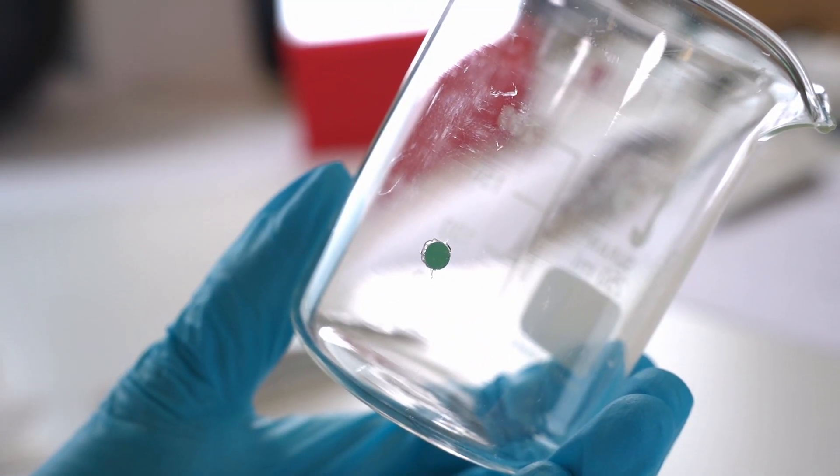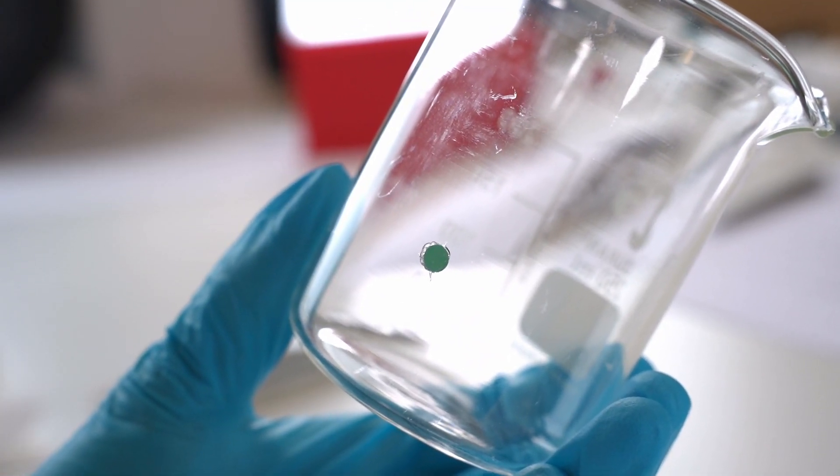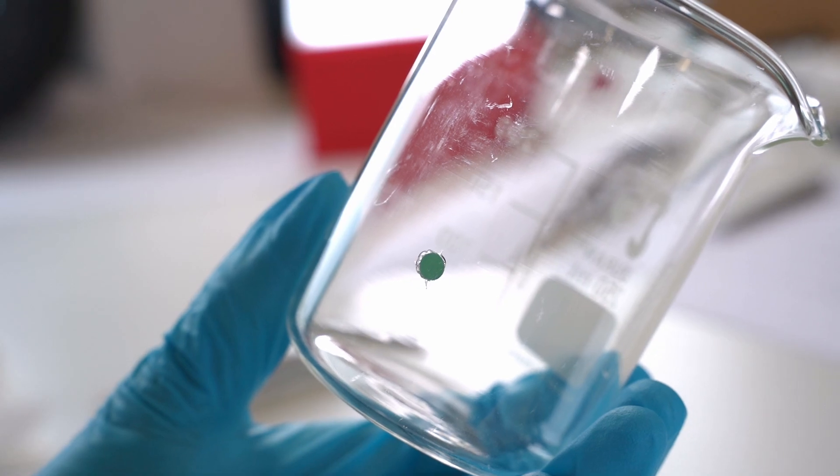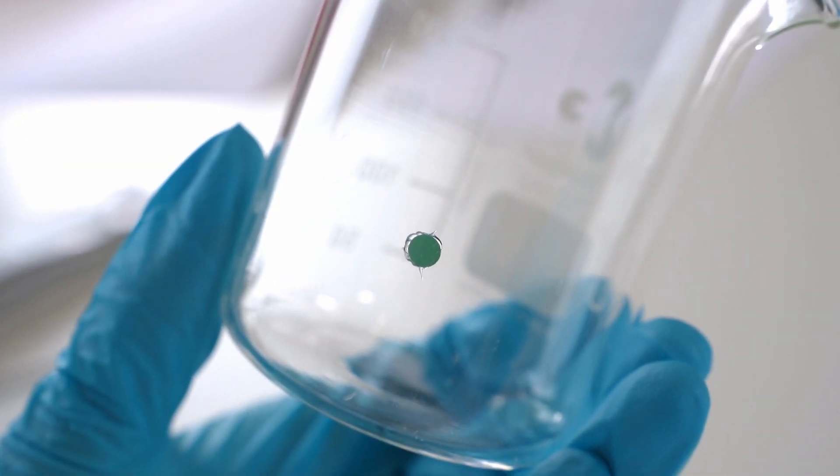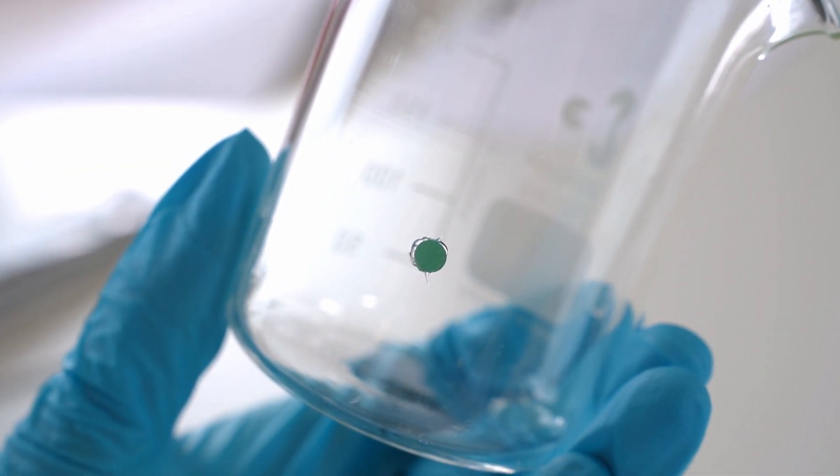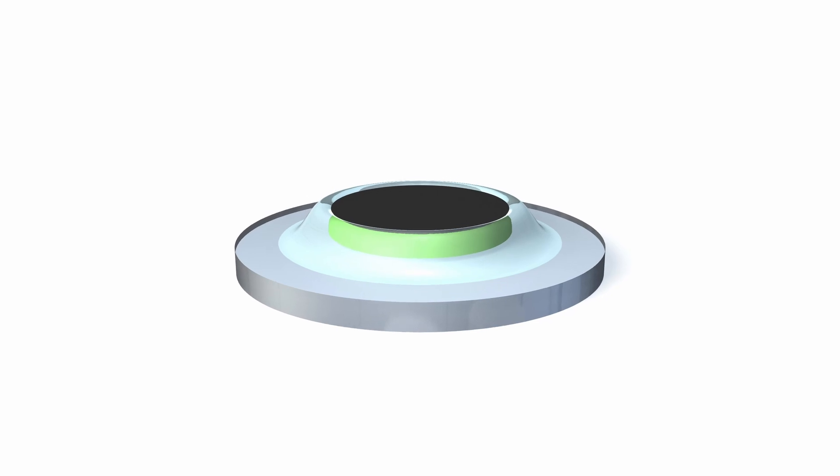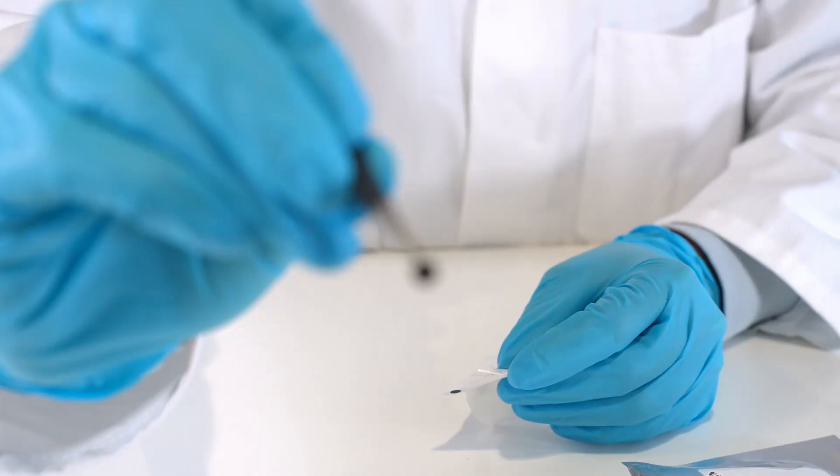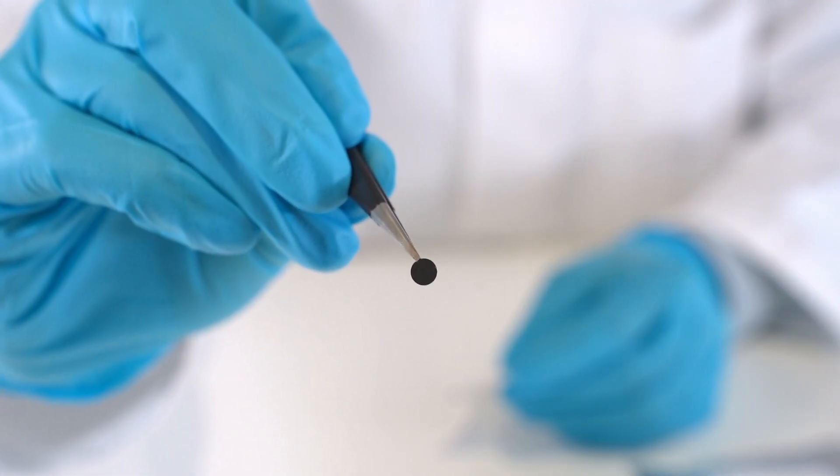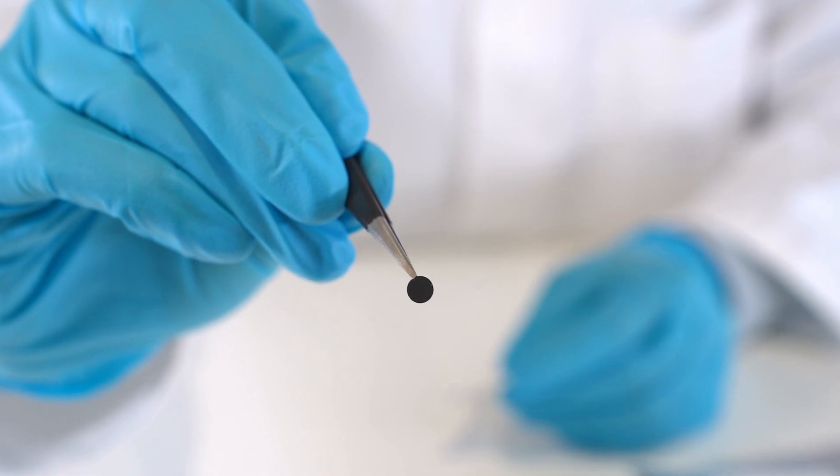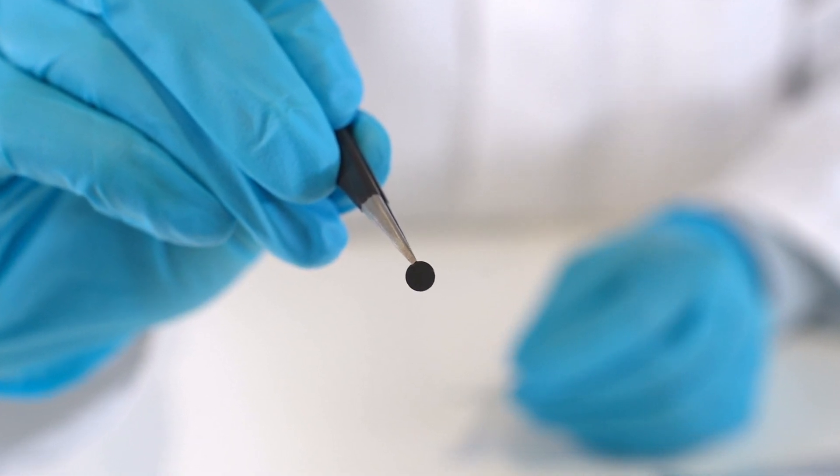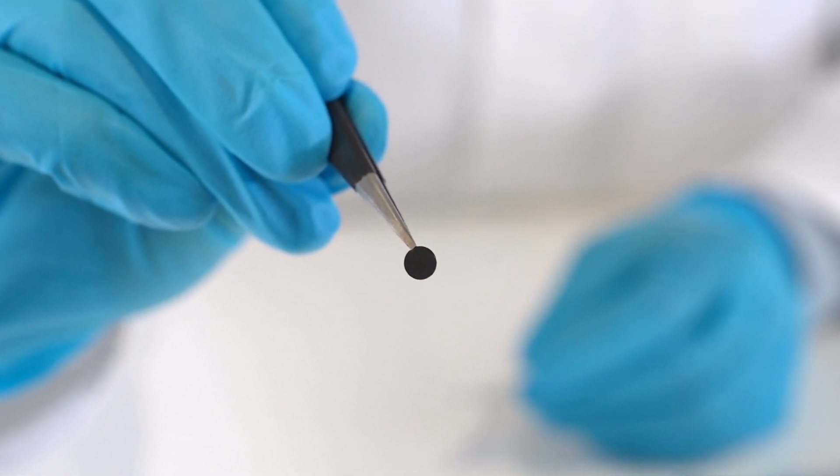For maximum mechanical long-term stability, surround the outer rim of the sensor spot with silicone glue. Ensure there are no air bubbles between the sensor spot and the container wall. Ensure that the entire green side is embedded in glue, but be careful not to get any glue on the central part of the black sensing surface. Glue on a sensor can lead to a significant increase of the response time.